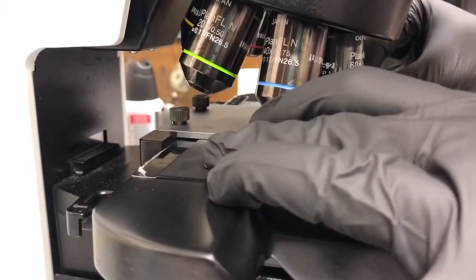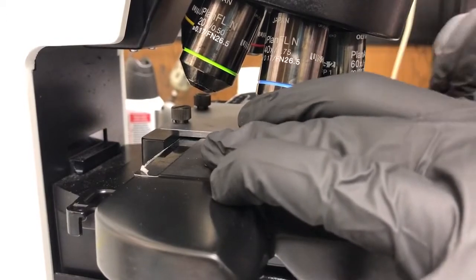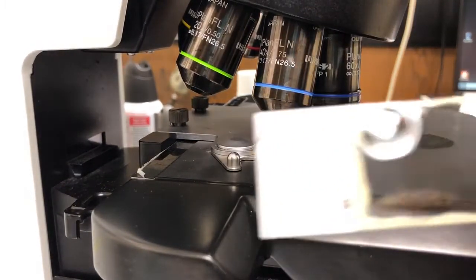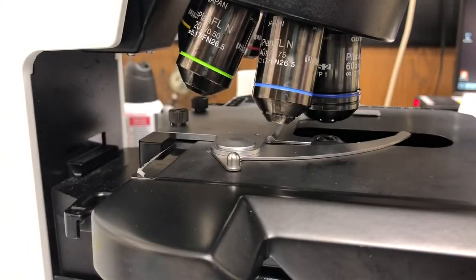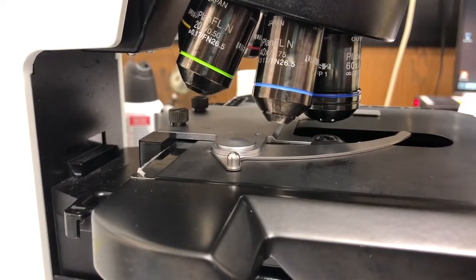So I'm going to move this out and see there's oil on the sample. I will clean that later.